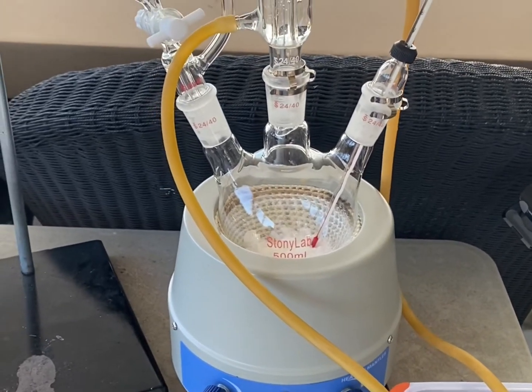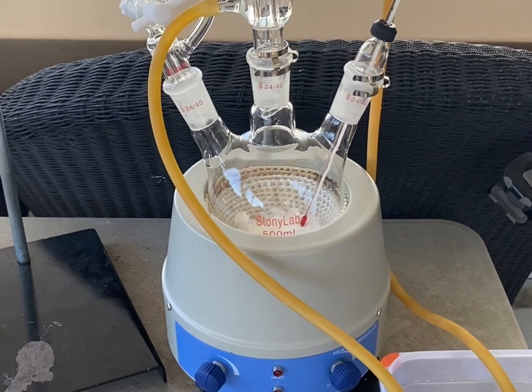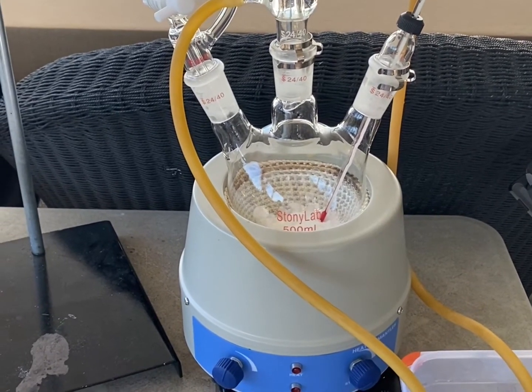Alright, so now we're going to start the sulfonation of naphthalene to make 2-naphthalene sulfonic acid.